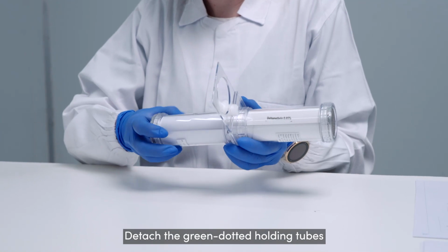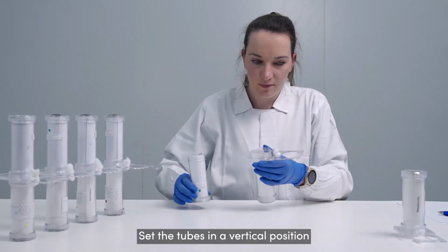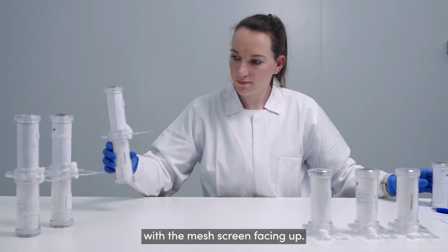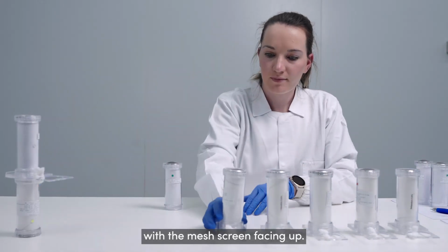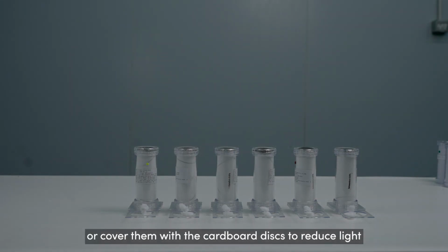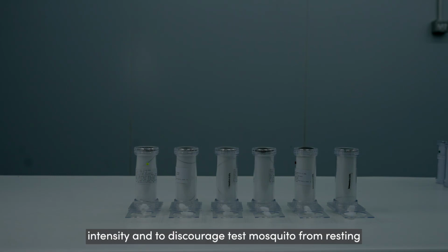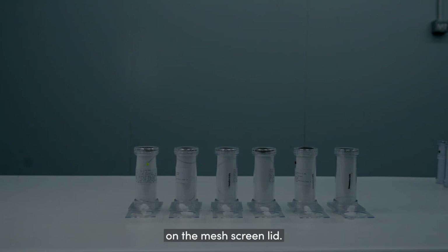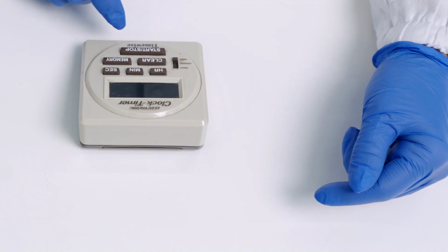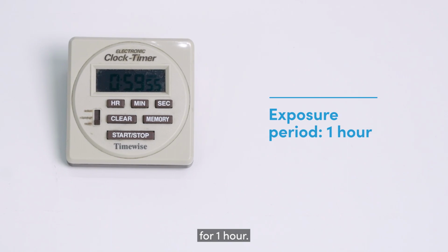Detach the green dotted holding tubes from the exposure tubes and set them aside. Set the tubes in a vertical position with the mesh screen facing up. Place them in an area of reduced lighting or cover them with the cardboard discs to reduce light intensity and to discourage test mosquitoes from resting on the mesh screen lid. Leave the mosquitoes in the exposure and control tubes for 1 hour.